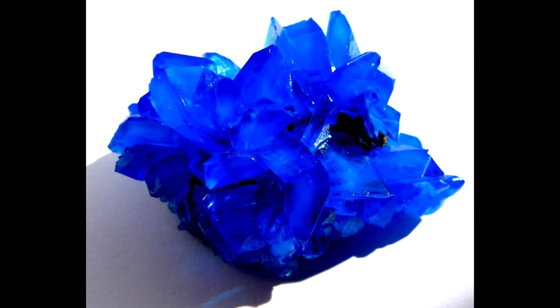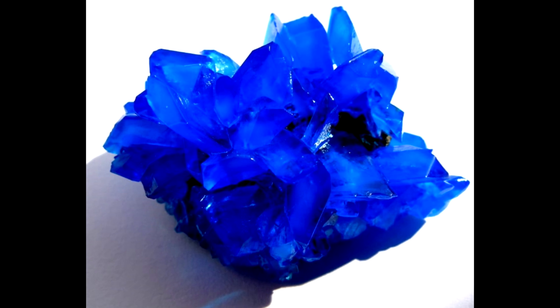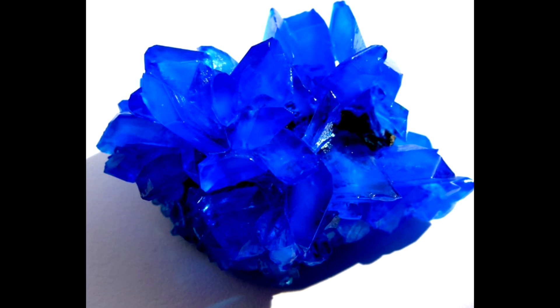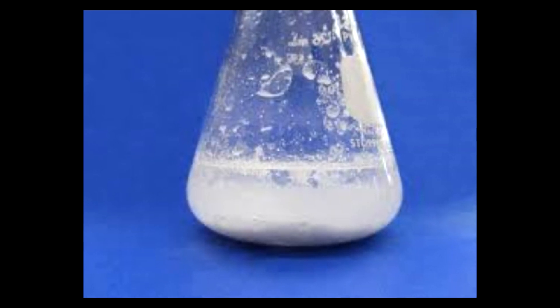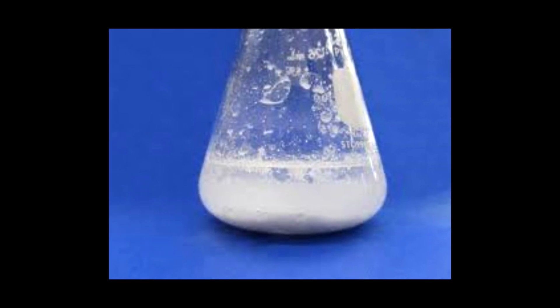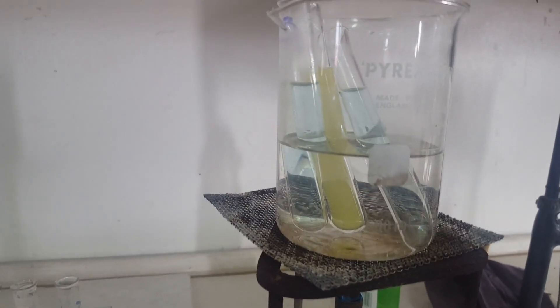The pentahydrate salt has a triclinic crystal structure, which results in large geometric shapes with flat faces. Copper sulfate is most used in the lab in its anhydrous form as a drying agent — it signifies the presence of water due to the color transition to blue as more copper sulfate pentahydrate is formed.